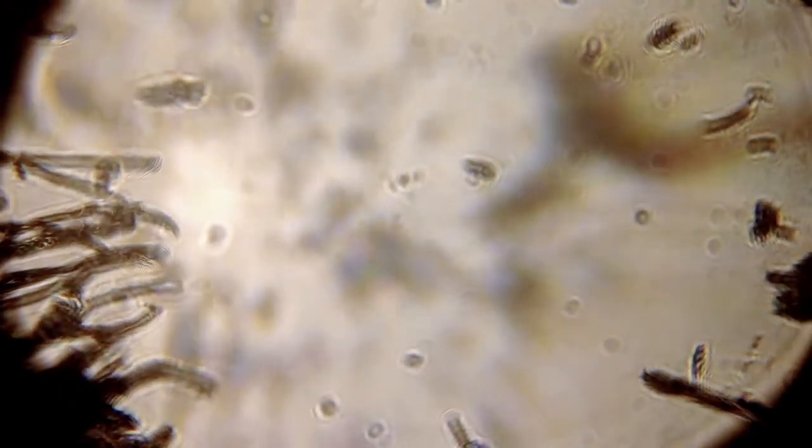But you can line this up on your webcam. Just eyeball it, like by looking in the screen and seeing what it looks like, and it should look like that. And then, oh, I forgot to show you. I will show you later. It's important to have then another light source. In this case, I'm just using a cheap IKEA desk lamp. But it's an LED light that points straight at the screen. I'm just going to line it up a little bit better. The little things you see off to the side are actually the paper fibers.